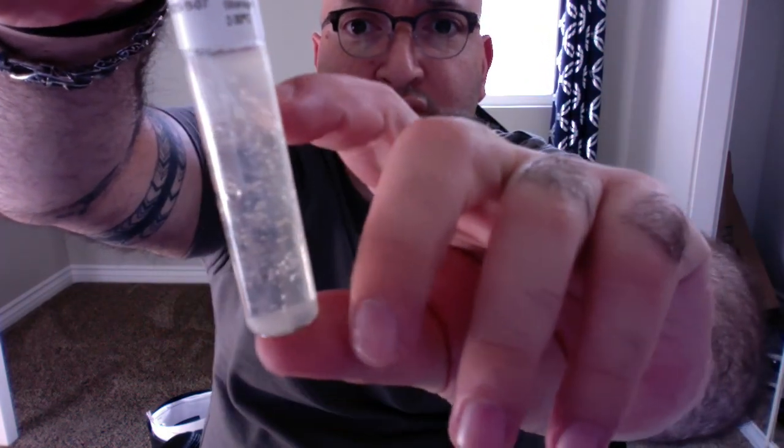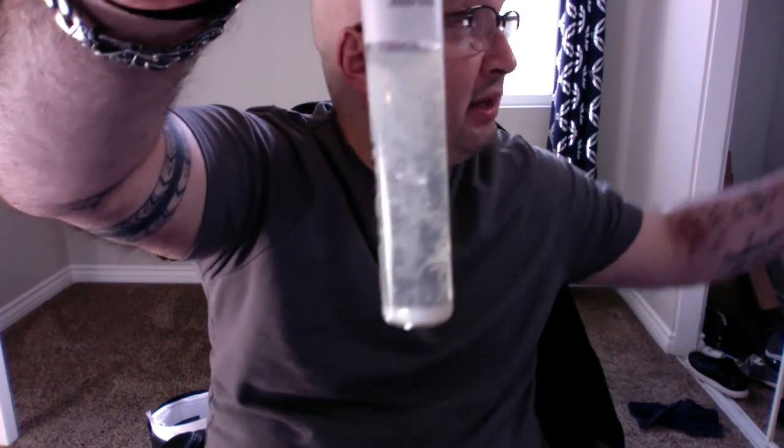As you can see, this agar is quite cloudy. There's a good quarter bit here, there's a lot of turbidity here, and then when brought up to a bright light, you can see in the center there's also turbidity, and that's where I stabbed the agar.